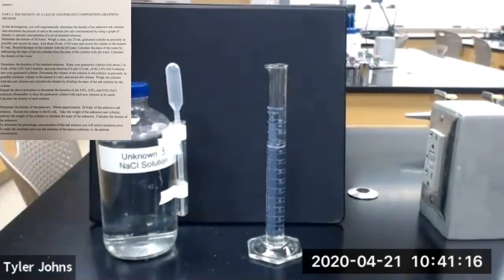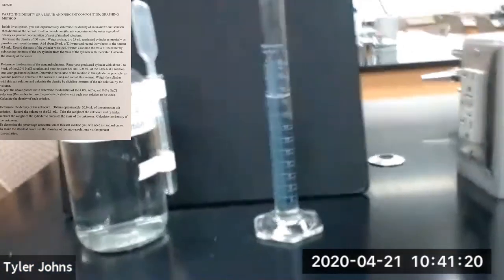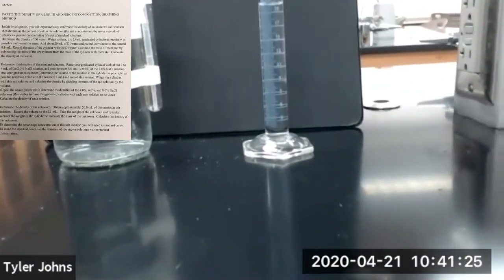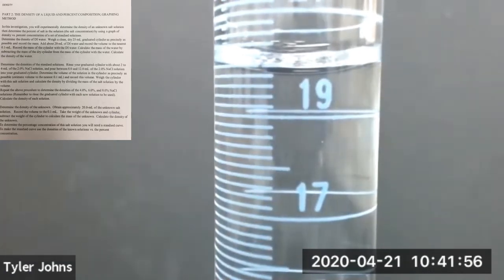And then we are going to determine the volume of unknown salt solution number 3 that we added to our 25 milliliter graduated cylinder. Okay, so this is the volume of unknown salt solution number 3 that we've added to our 25 milliliter graduated cylinder.